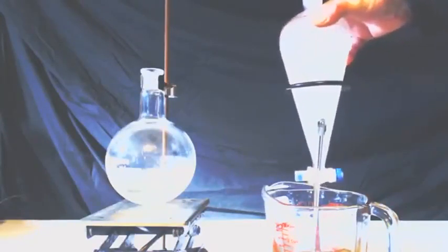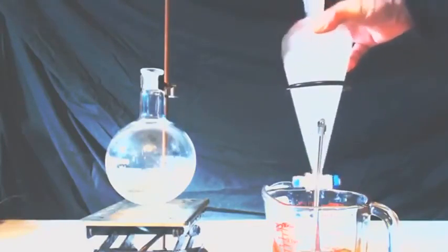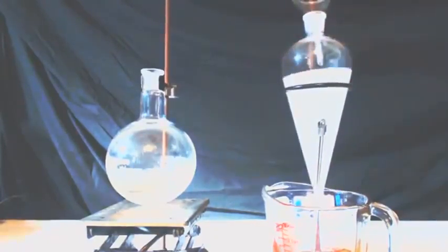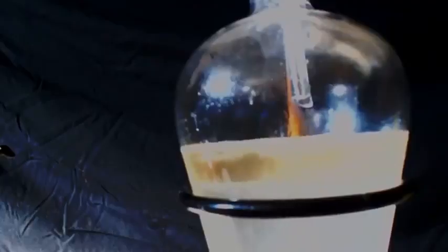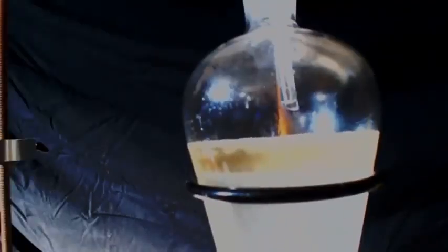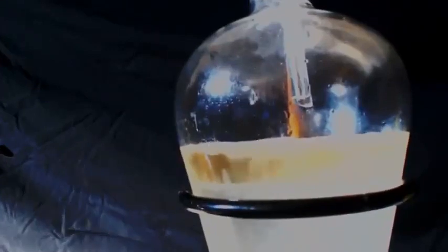Shaking it up, and then all the acetone, or most of the acetone should go to the water layer, and then the top layer would be just the hydrocarbons, including the toluene. As you can see, the bubbling there, that's probably the carbon dioxide coming out.